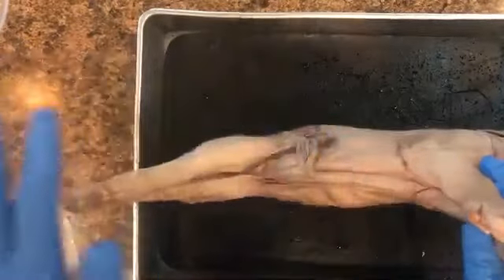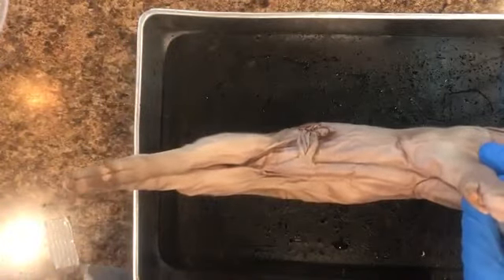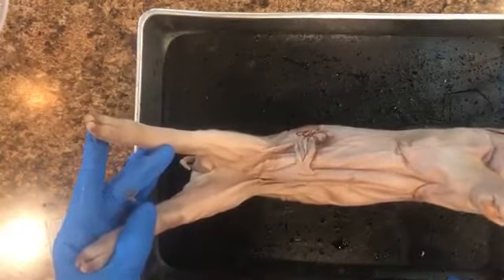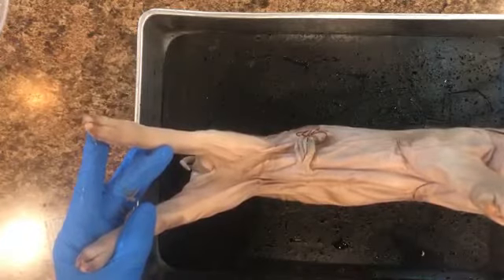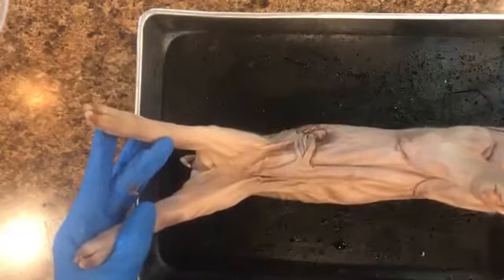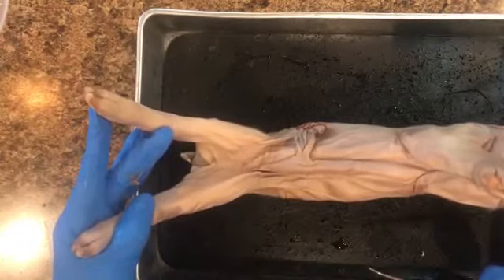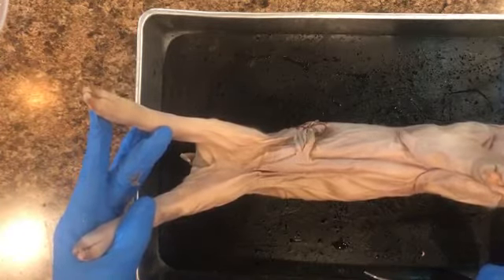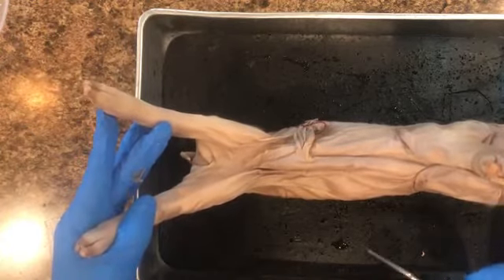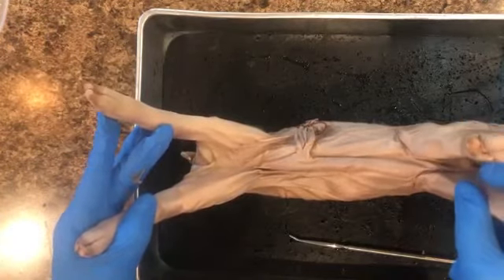Before I go ahead and say, hey, this is a boy or this is a girl, males are going to have a urogenital opening just posterior to the umbilical cord. So here's the umbilical cord. They're also going to have a scrotal sac just ventral to the anus, so closer to the belly end, not closer to the tail end of the anus. Females are going to have a urogenital opening ventral to the anus, and it is surrounded by folds called labia. The genital papillae will protrude just ventral to the opening. Okay, I'm going to show you two pictures, males versus females at this time.